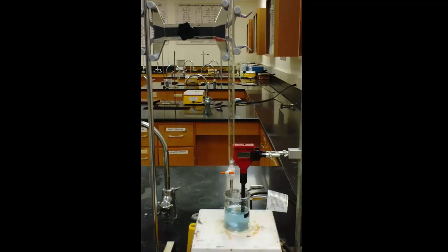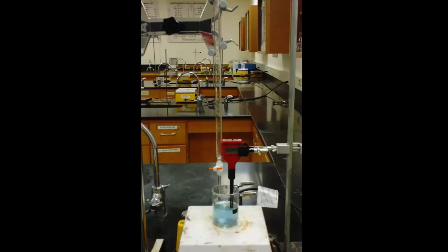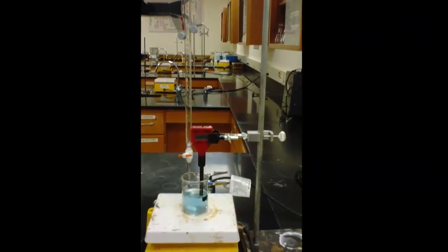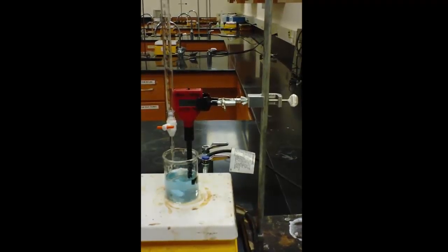You need to do this so that the beaker is in the center of the spin plate and so the burette drops directly into it. You're going to need your second ringstand clamped to a pH meter and you need to have it set up like this.